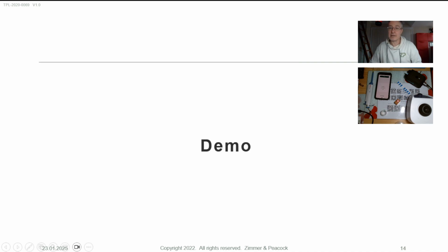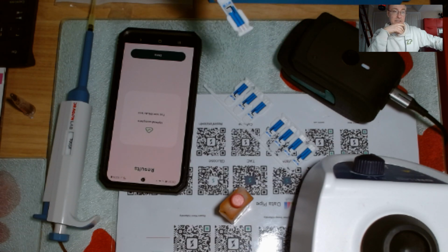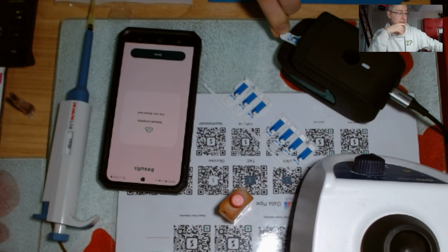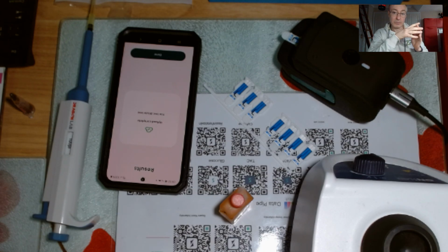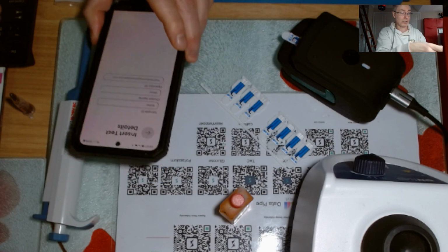So I'll try and do a demo to figure out what is going on here. The first thing that can happen, and this has happened in the past for this particular client, is I'll take a sensor. I've actually got a liquid on that sensor at the moment. This is not the best way to do things, but I'll take a sensor and put it in there. This is not what this client's doing at this moment, but I'll just show you a scenario, and then I will just go.